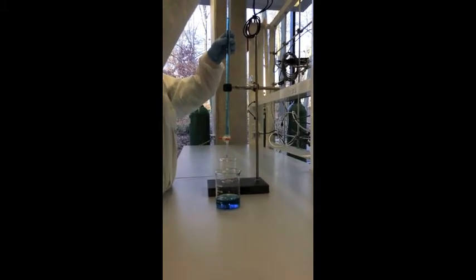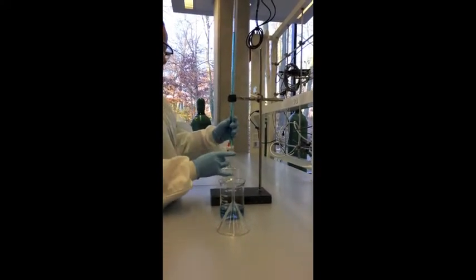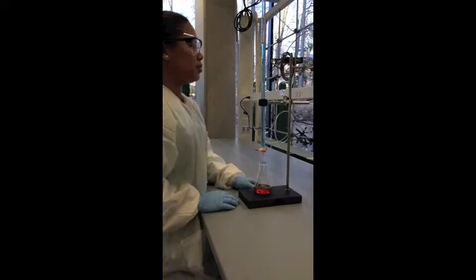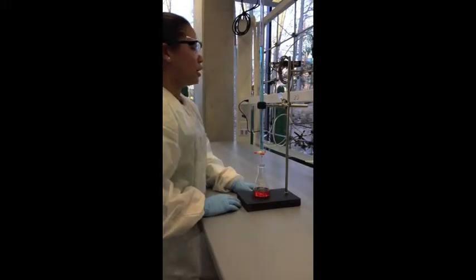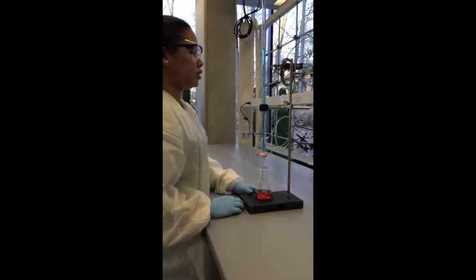Check the tip of the burette for an air bubble. To remove an air bubble, flick the side of the burette while solution is flowing. Once air bubbles are removed, take an initial volume reading. Be sure that the volume is read from the bottom of the meniscus and at eye level. Before starting the titration, make sure the burette is completely vertical.